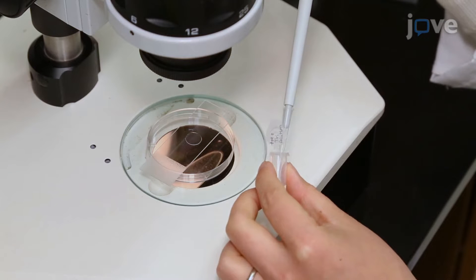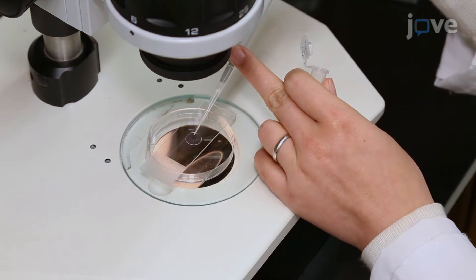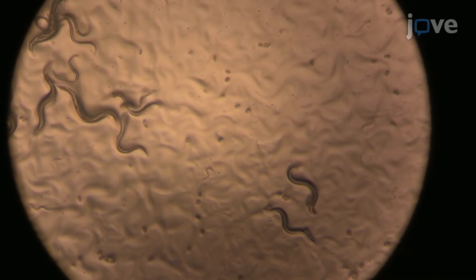The main advantage of this technique stems from the transparent epidermis of the C. elegans, which allows experimenters to easily visualize and record sperm movement in live animals.